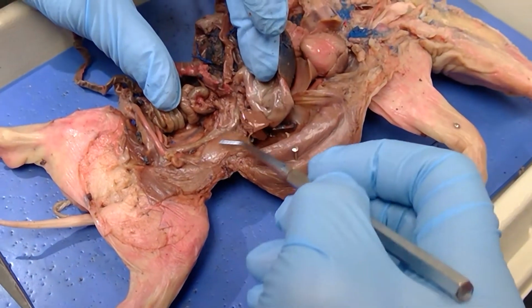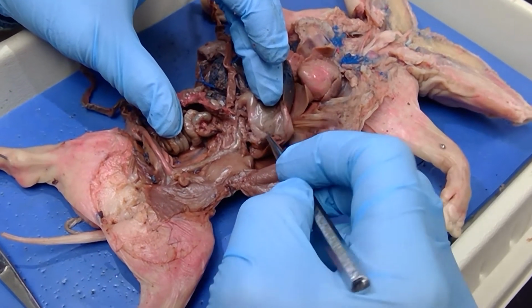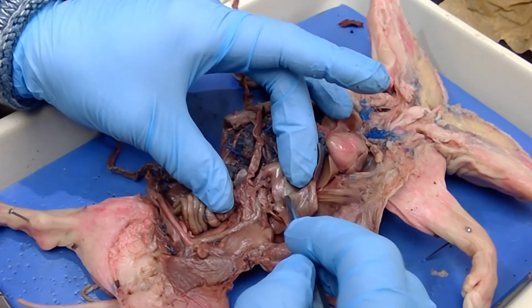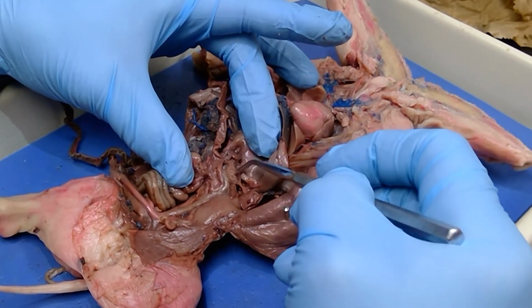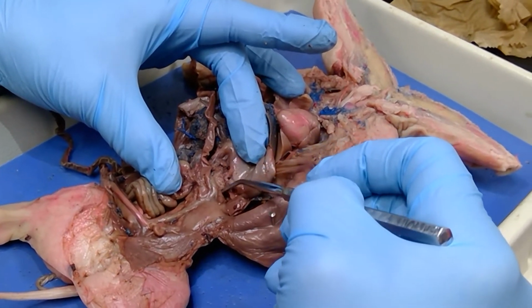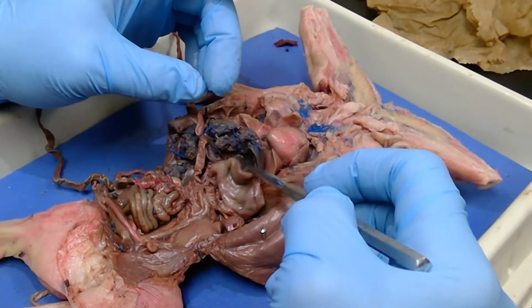This is the spleen here. The spleen is located here, this brown structure here. It's kind of torn in, it's halfway in two there. The pancreas. The pancreas is this material right here over to the spleen. You see it's got this part right here. So it goes from here on over here to the spleen. That's the pancreas.